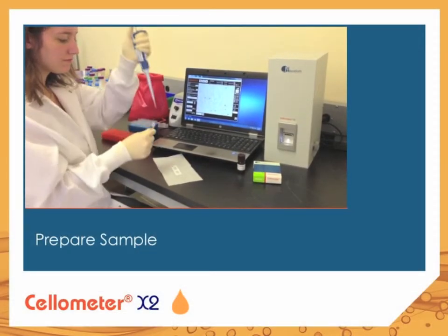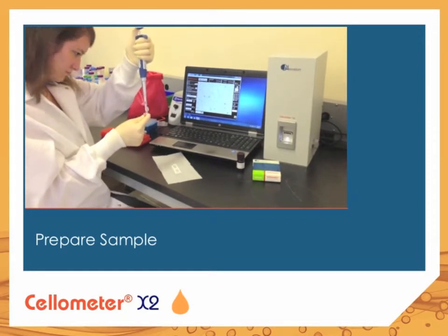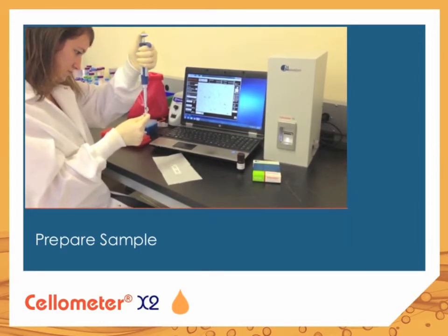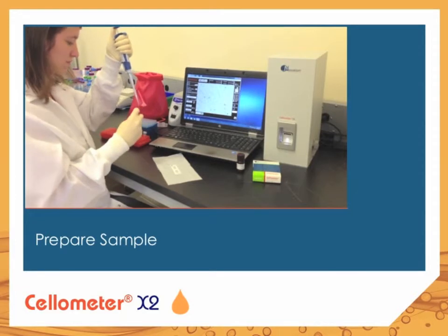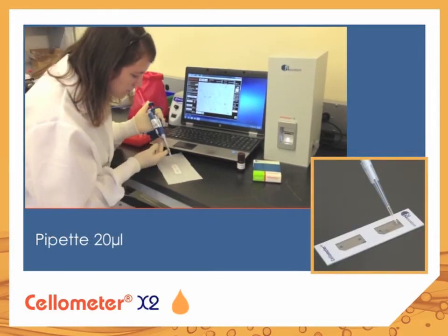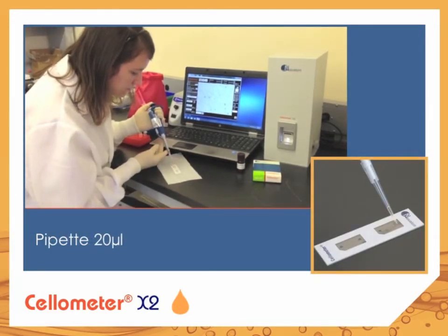Here is an example of a viability measurement. 20 microliters of yeast sample is mixed with propidium iodide solution and then loaded into the Cellometer counting chamber.